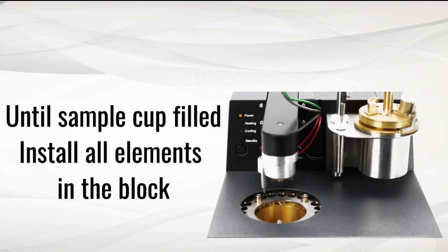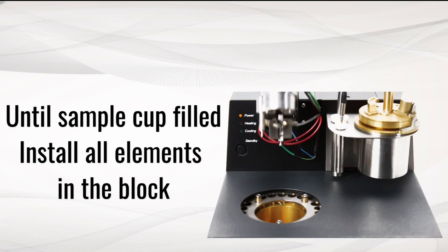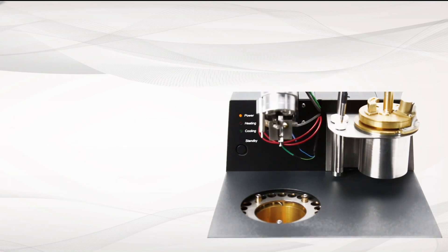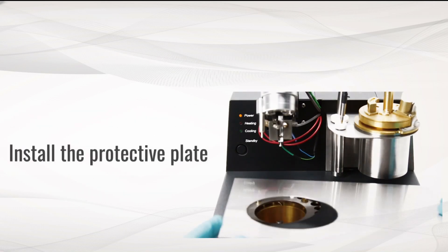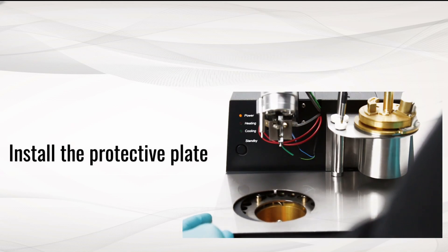Fill the cup with the sample to be tested. Install all elements in the block. Install the protective panel.